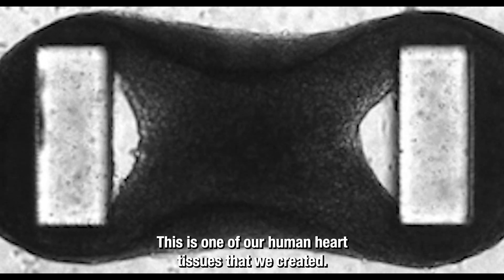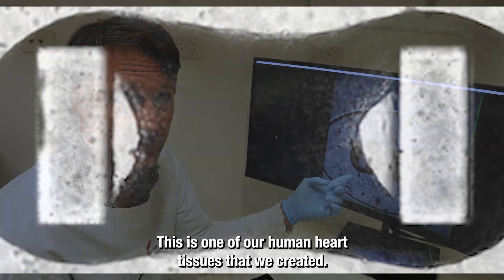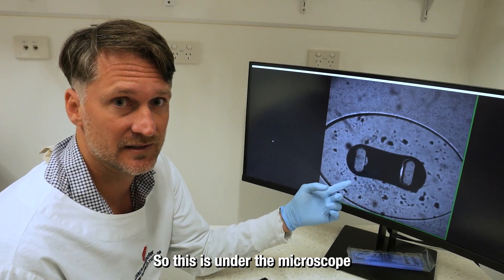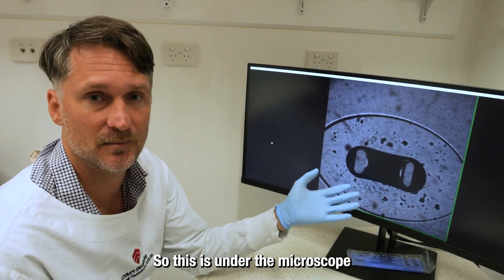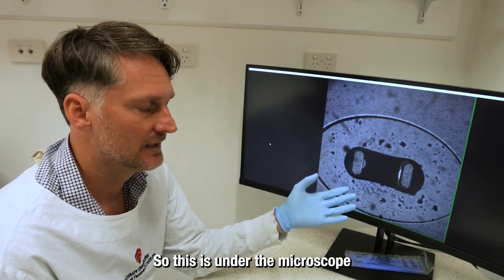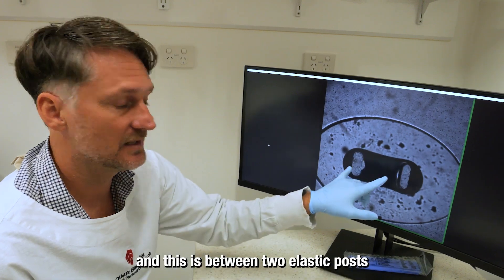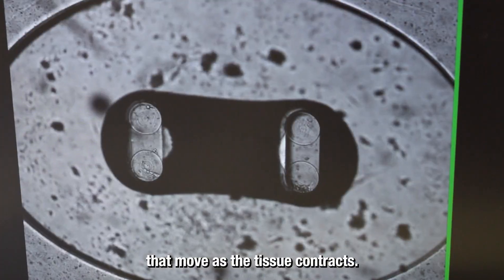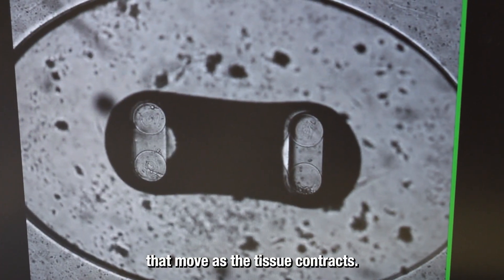This is one of our human heart tissues that we create. This is under the microscope, and it is between two elastic posts that move as the tissue contracts.